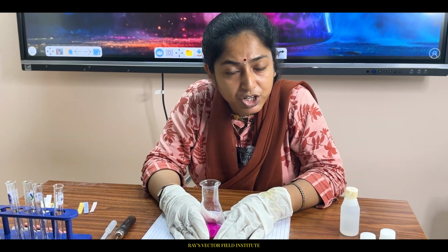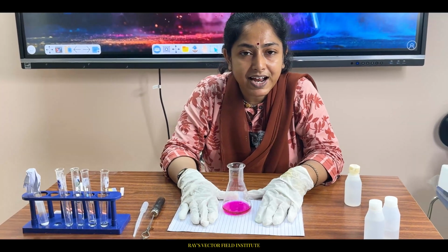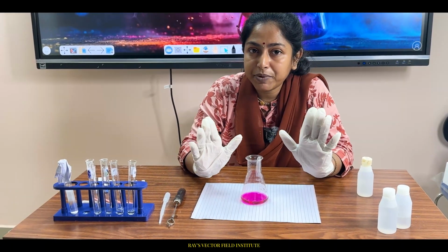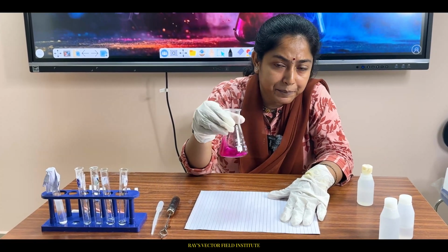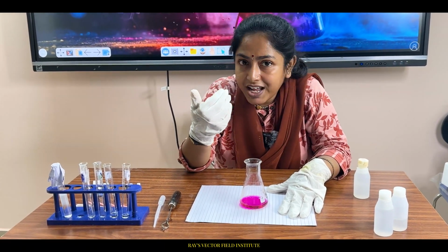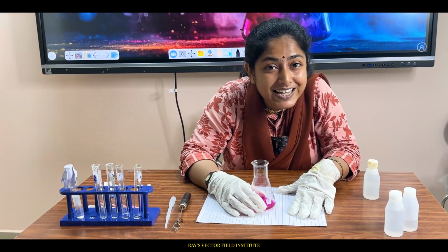What is the point of equivalence? Here the point of equivalence signifies that a certain amount of acid has been completely neutralized by a certain amount of base. But since dark pink has appeared, it means that the acid base reaction has completed, and the salt formed is of basic nature.